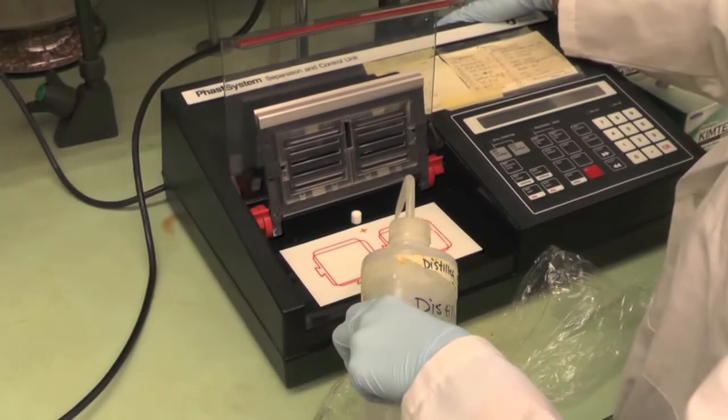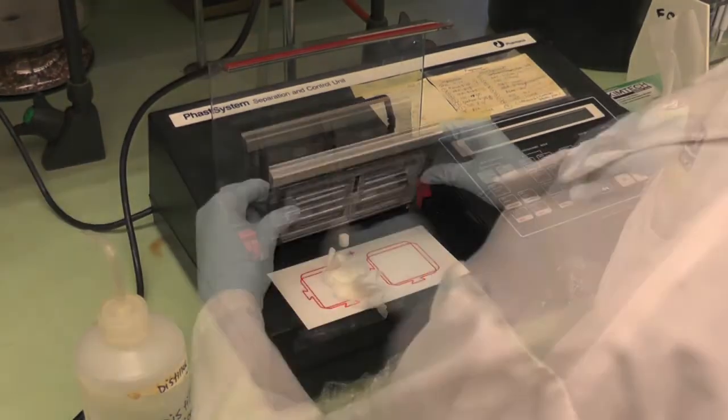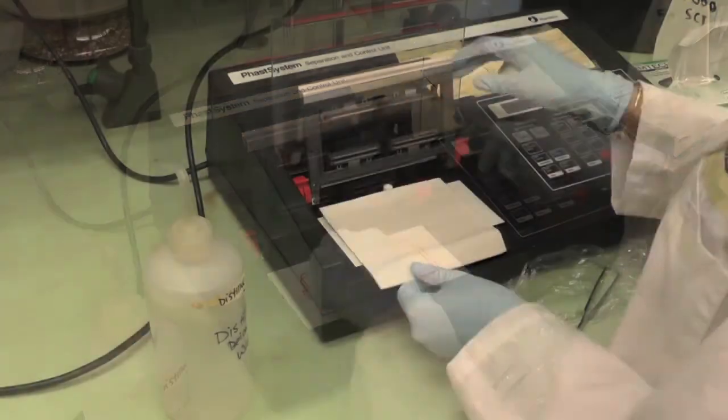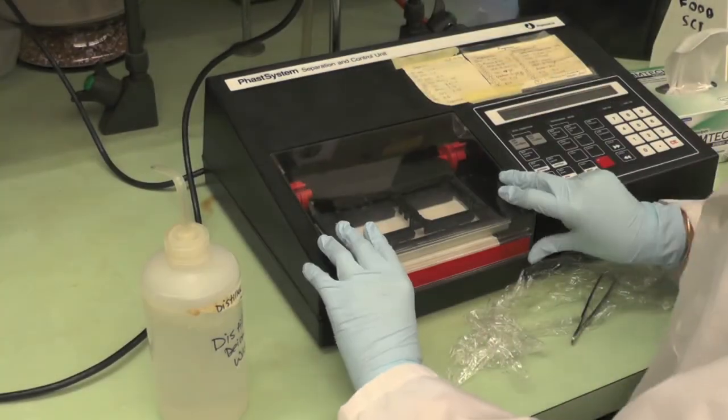Clean the apparatus with dd water and wipe with Kim wipes. Lastly, turn off the machine and sign the logbook if available.